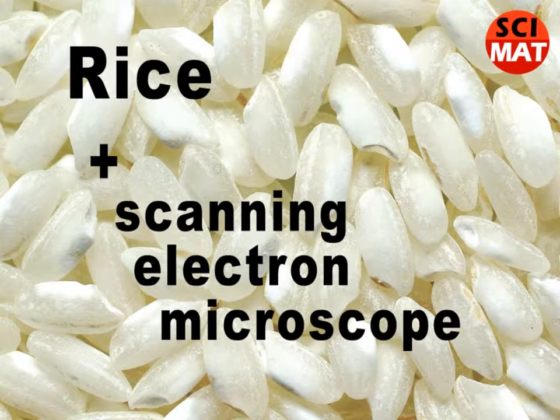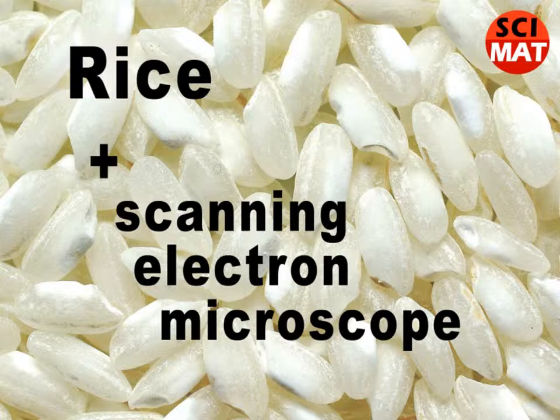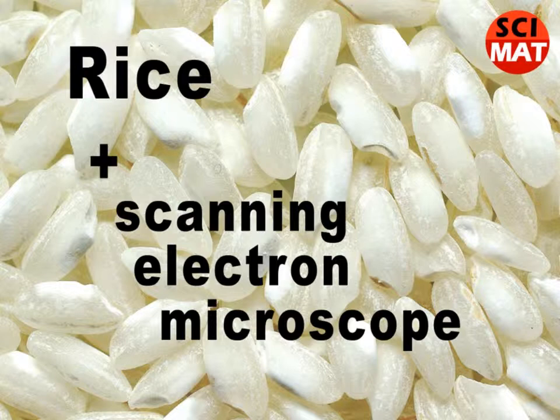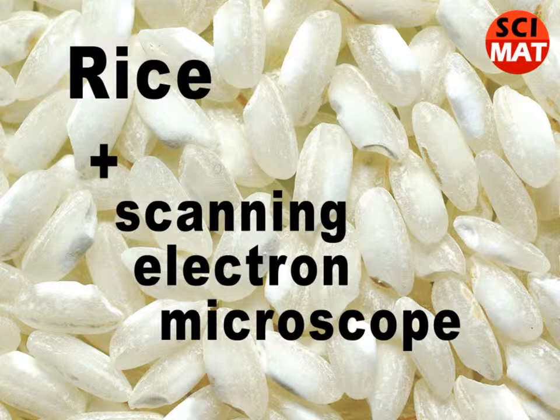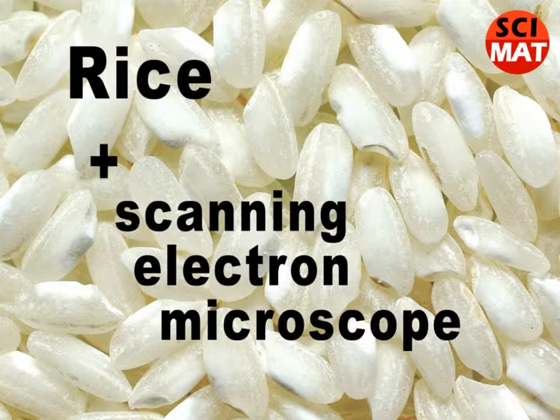Welcome to the table where rice is being served — only a very few varieties of a total of about 2,500. Who is serving them? Not a chef, but Canadian scientist Milos Kala. Steamed, fried, puffed — all kinds of them in the form of photographs and electron microscopy images, with a side dish of explanation of what they mean.